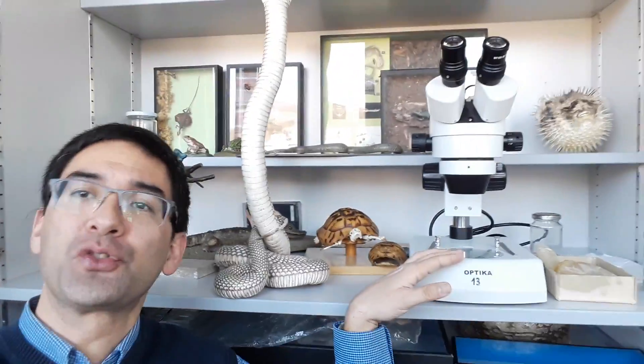Hello and welcome. Microbe Hunter here. I am in the educational supplies room of my school, and today I want to show you how to use a stereomicroscope.